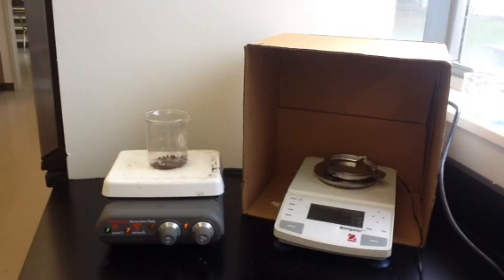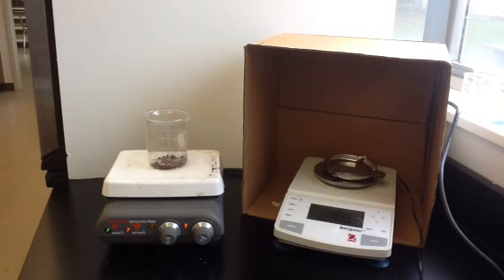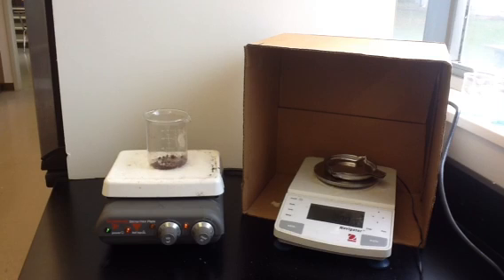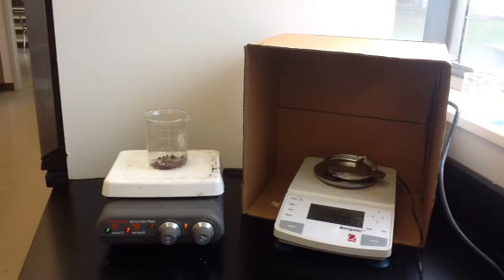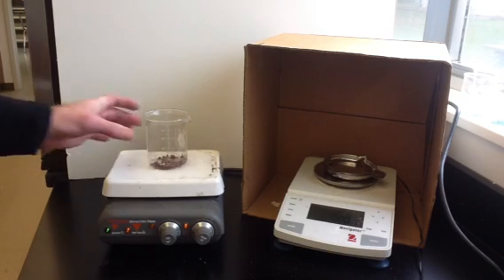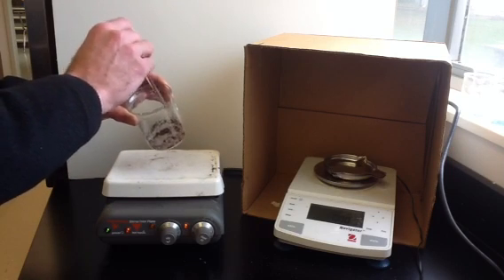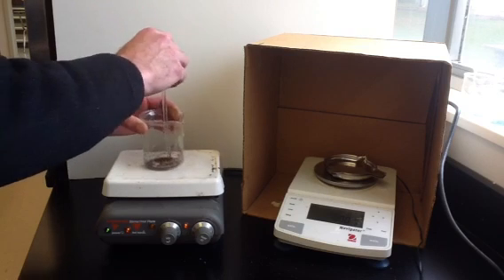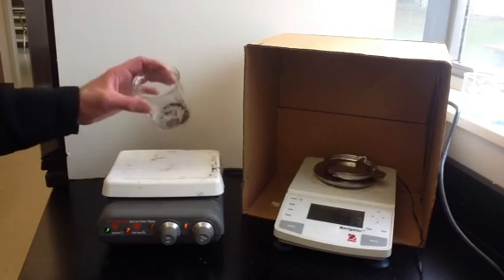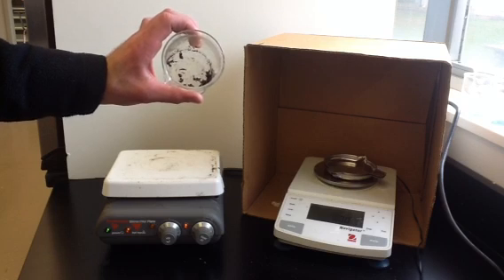The reaction has already taken place. Now we're just trying to clean the copper and dry it so we can get an accurate measurement of the mass of the dry copper. Hopefully it'll be close to one of the masses we predicted based on the stoichiometry, and then we'll see which one it's closer to. There's your copper metal at the end — you can see it has the distinct copper color, no longer the blackish color of iron but more of an orange color.